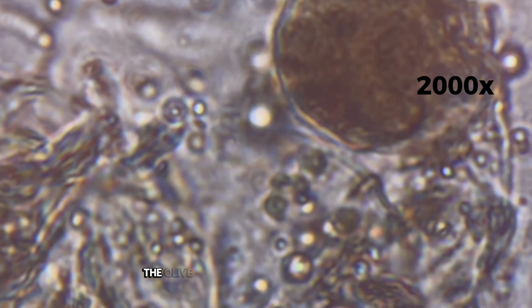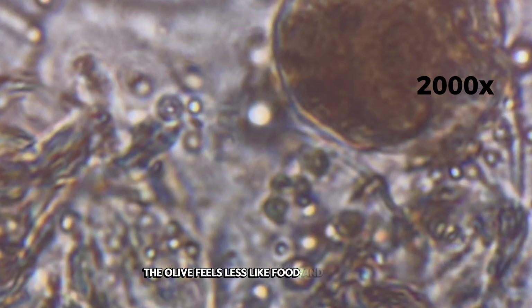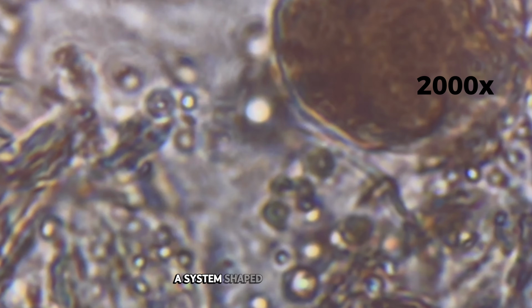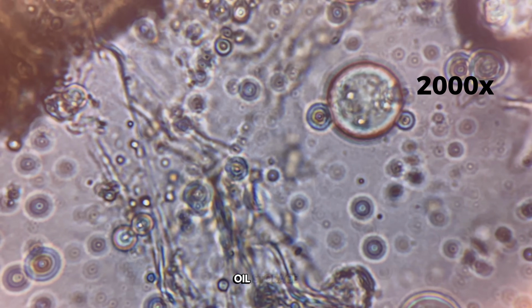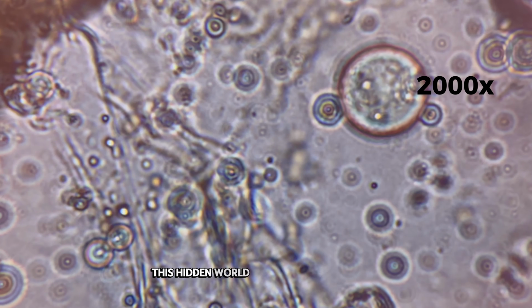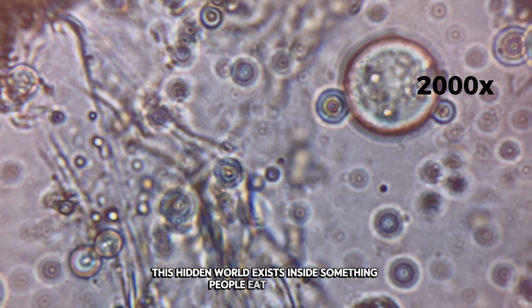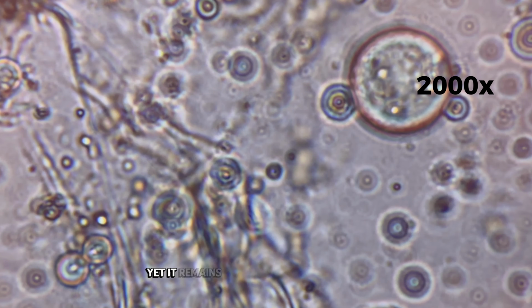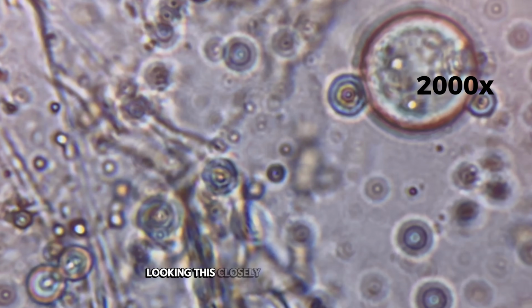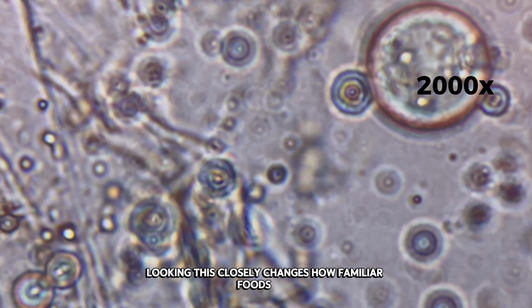At this level, the olive feels less like food and more like a microscopic ecosystem. A system shaped by plant growth, oil storage, curing, and time. This hidden world exists inside something people eat every day, yet it remains completely unseen in normal life. Looking this closely changes how familiar foods feel.